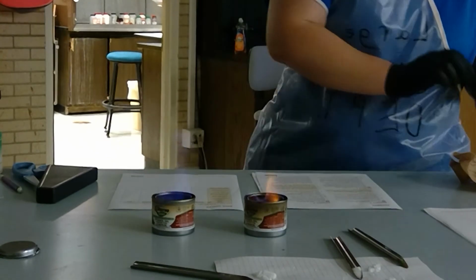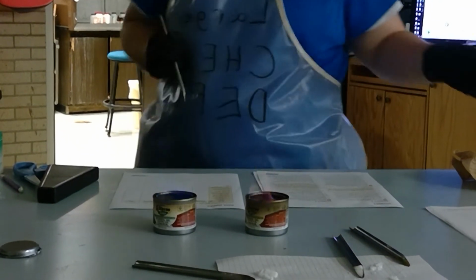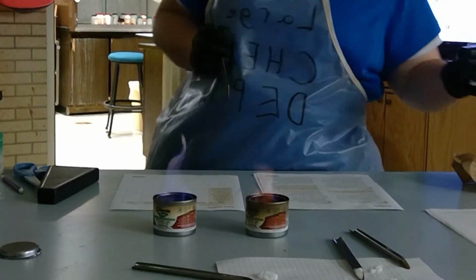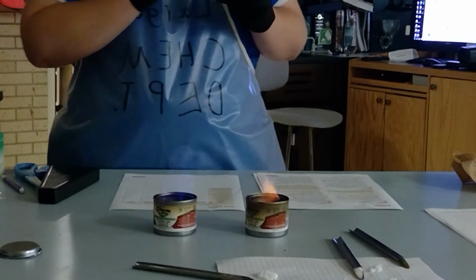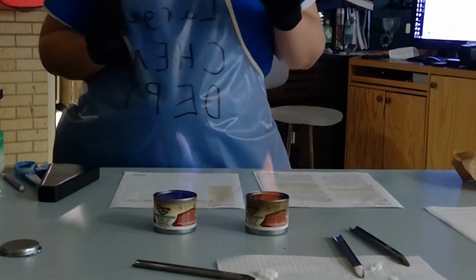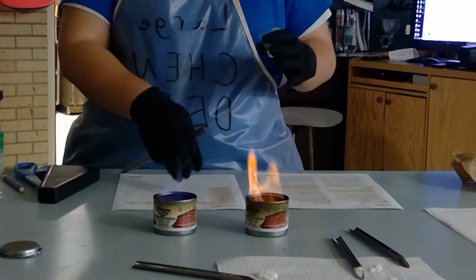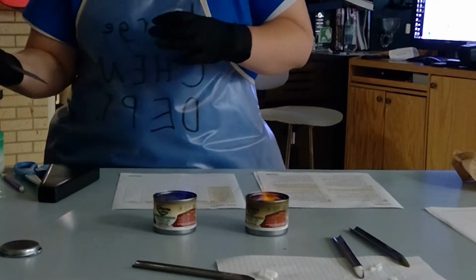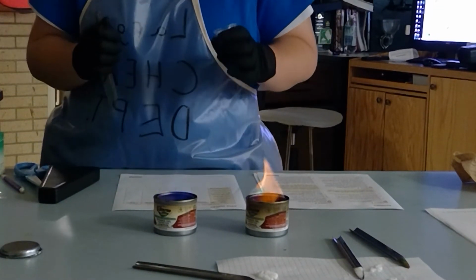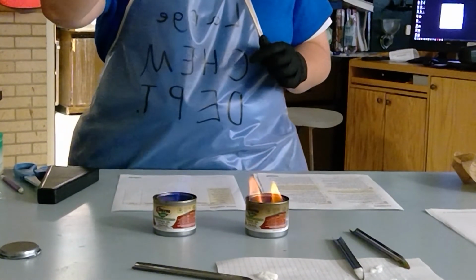And your sterno burns blue, by the way. Yes. The burning of the blue is because sterno is ethanol, and ethanol is very flammable. All right. Now, in order to do this sample, you need to know the colors of the flame. So potassium chloride will burn what color, sodium chloride will burn what color? Because in this cup here, it's a white solid.